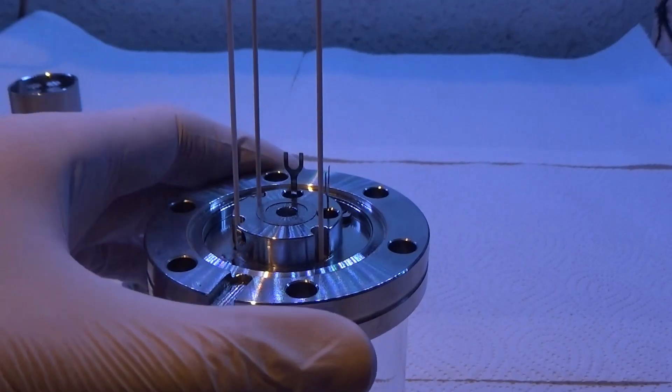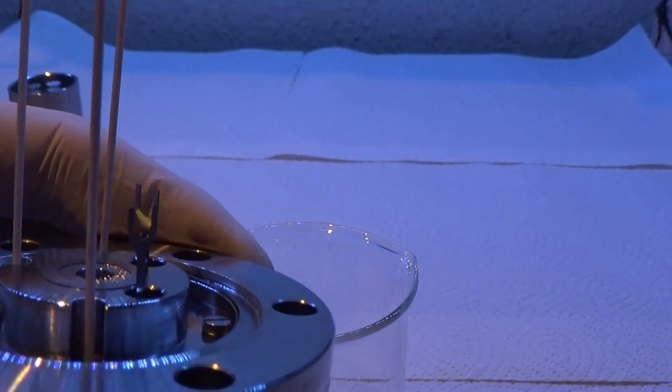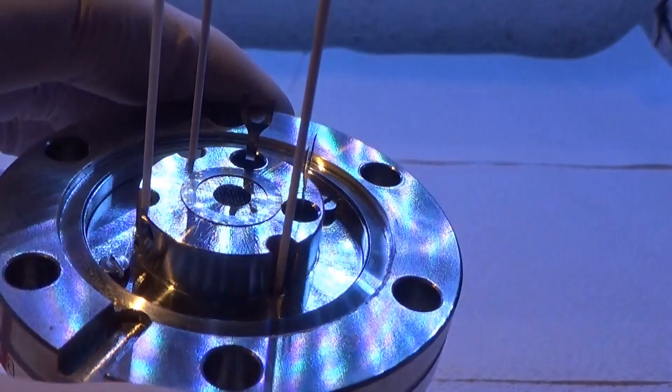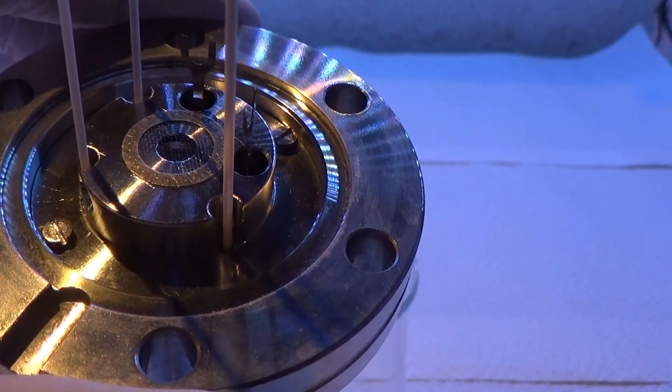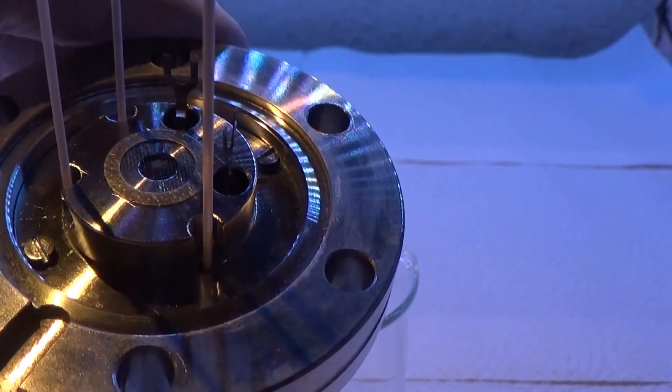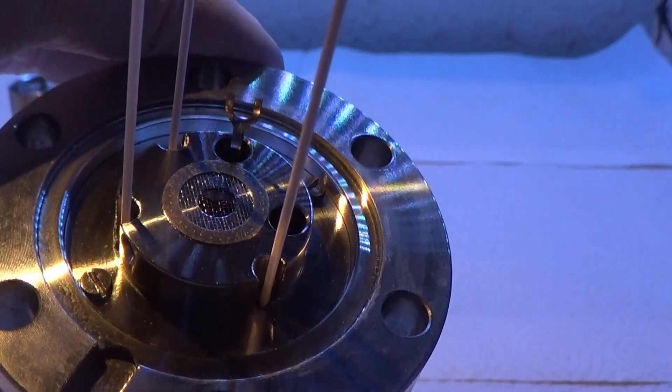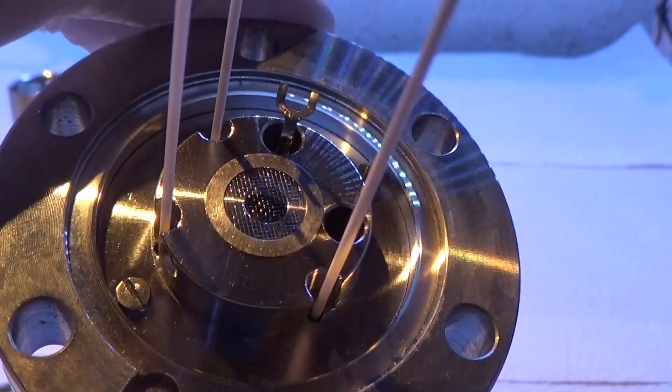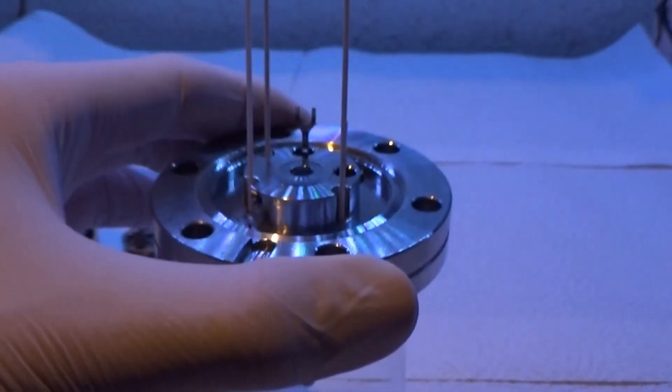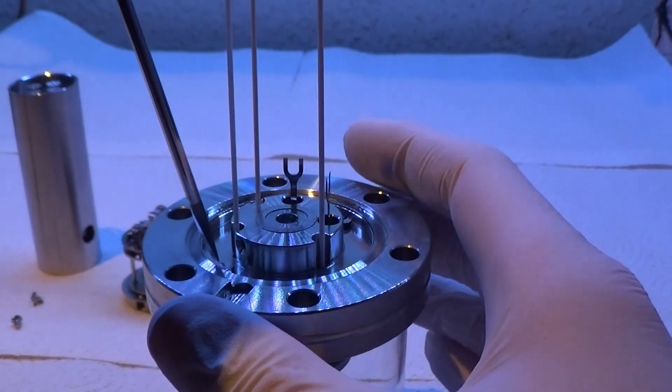So what do we see here? Well, first of all, we see these weird spade connectors that connect to the quadrupole. And as you can see, this plate is just grounded to the envelope of the vacuum system. This is always a good sign, because this means that it's at zero volts, always. When you have to deal with ion optics, especially unknown ion optics, that's kind of a gift that you know that. And as you can see, there's also a screen over there. Now we unscrew the last bit so we can get to see the detector.